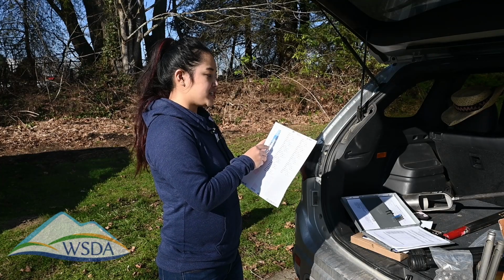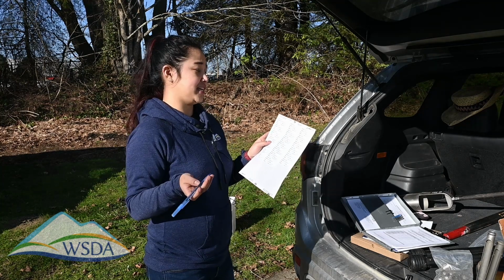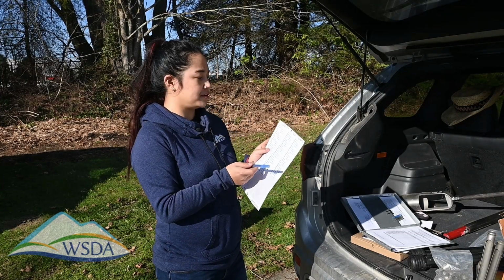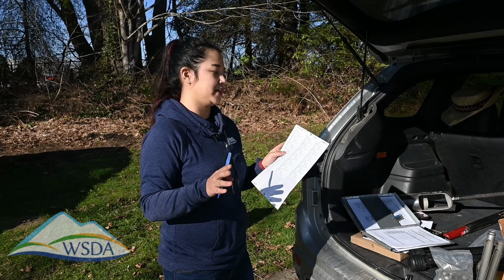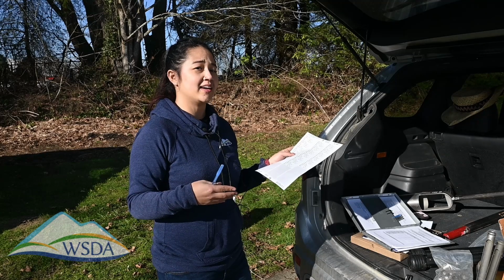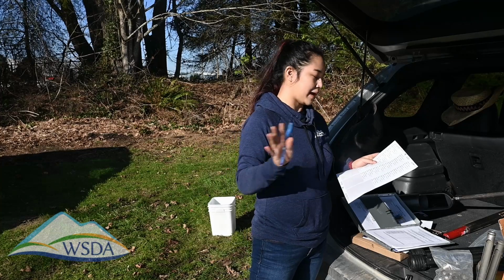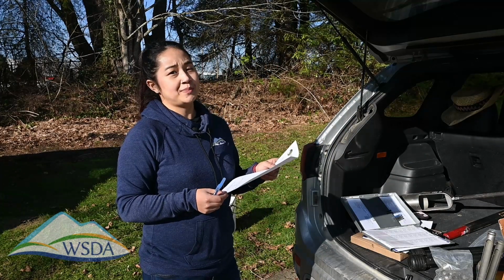You'll want to note the project. So for this scenario, it will be WASHI, W-A-S-H-I, your sample ID, the date, the time of your site arrival, which should match the field form, and then also your sampler initials and your organization. And all of this information makes sure that the sample is being tracked appropriately from the time you send it to the lab on the chain of custody and when the lab receives it, and they can track the same sample throughout that process.